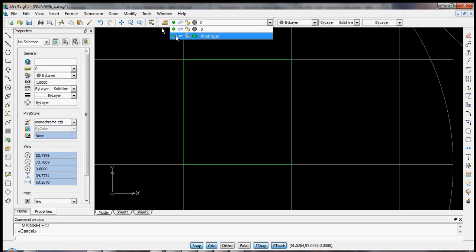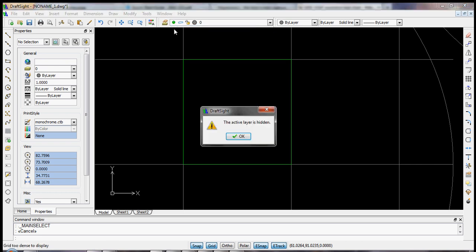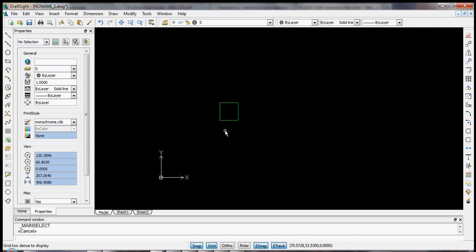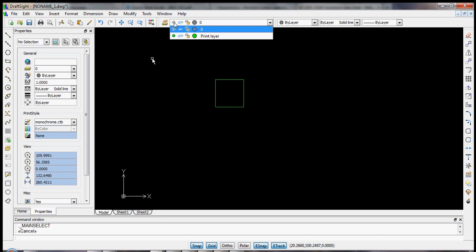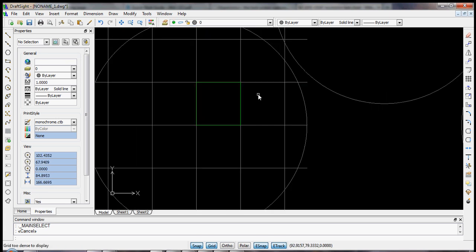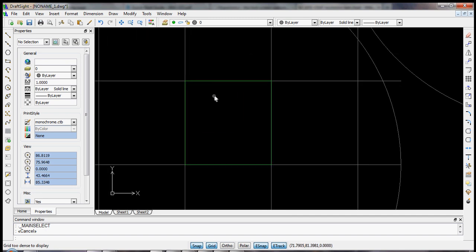So here we can turn off. This green light means that the layer is displayed. We can hide the active layer. Now you see only our print layer. And you can turn these on and off. So that's the use of layers. You can lock them so they can't move, and you can turn them on and off as you will.